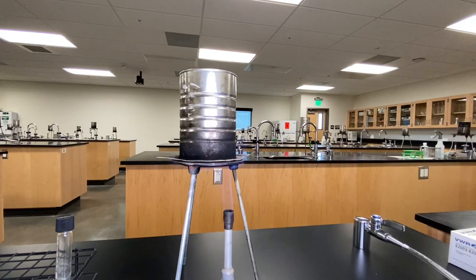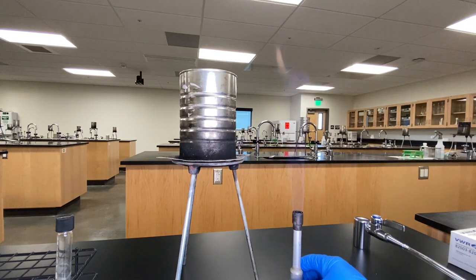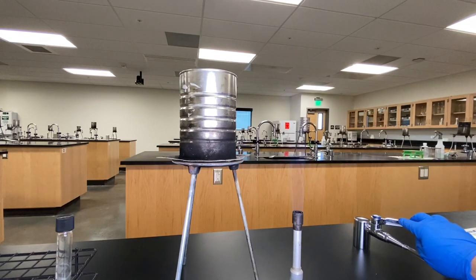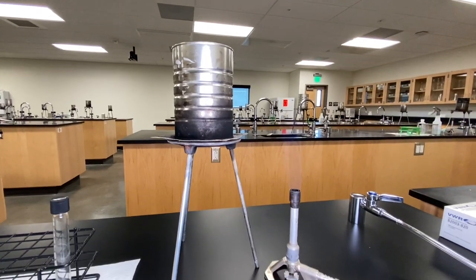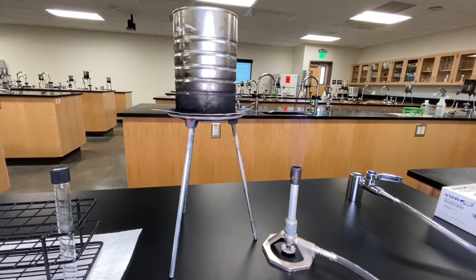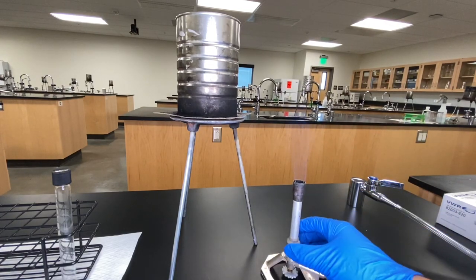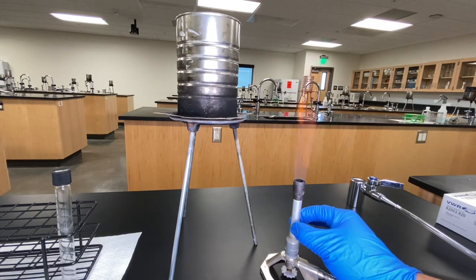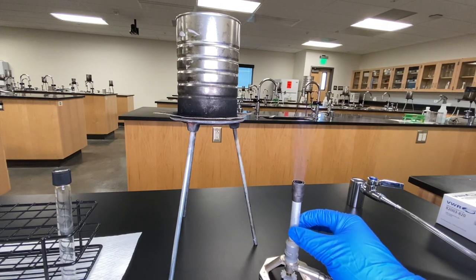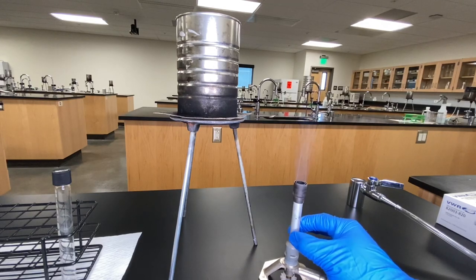We're not going to use it with the water in this case, so we're going to move it over here. You'll notice the flame is fairly large, so we're going to close the amount of gas to control that — that's the easiest way to make that adjustment. Now we have a nice neat little flame, and to run a sterile environment we want that two-cone system, so we'll add oxygen by opening the valve. You'll notice it changes color and sound, and then you'll see the two-cone system visibly.